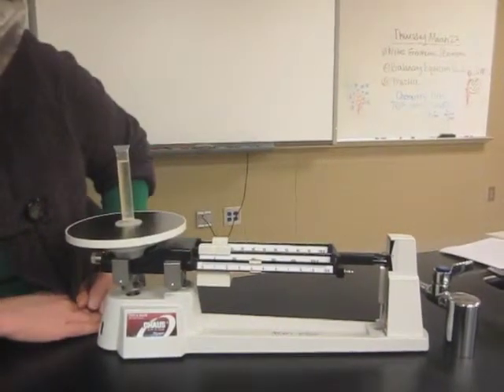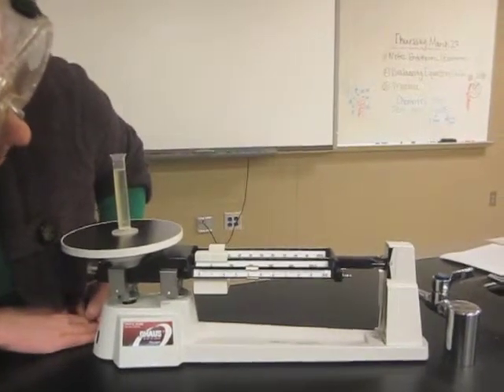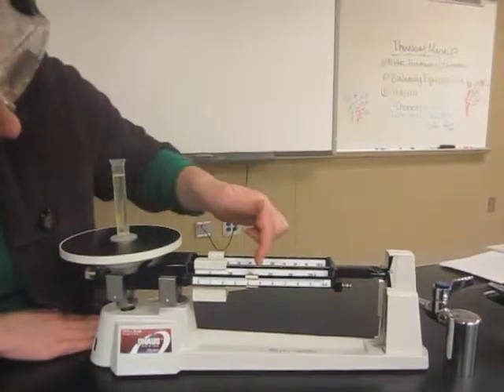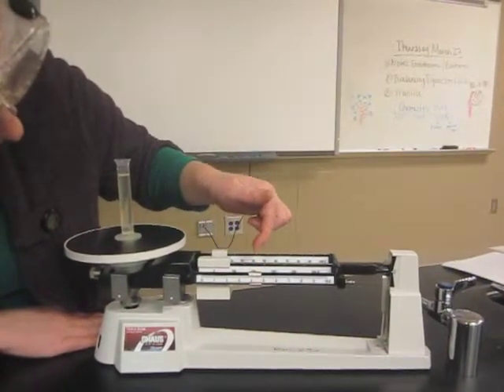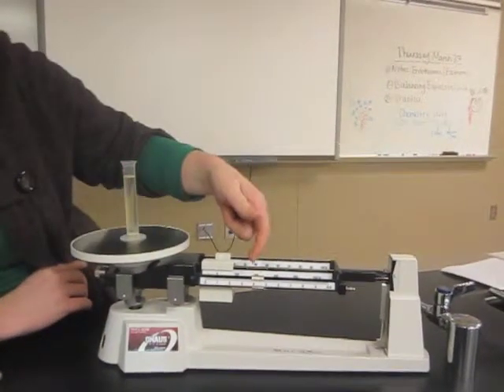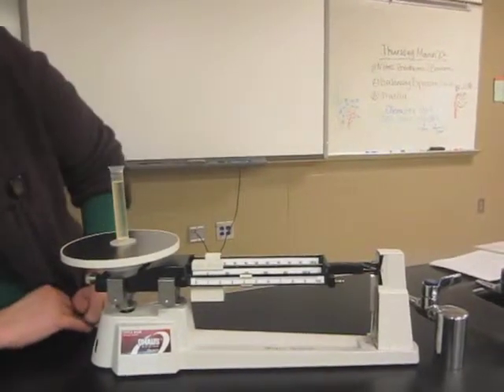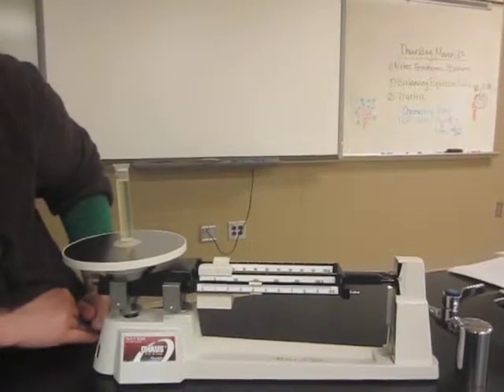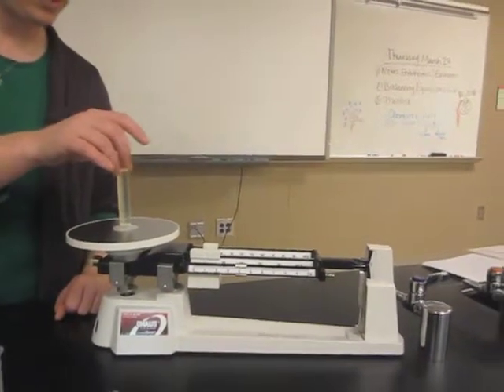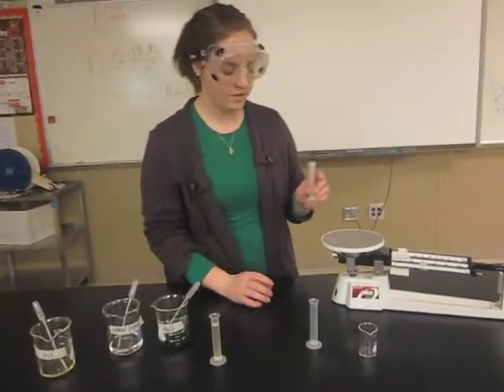The final mass of your graduated cylinder with oil is approximately 14.3 grams. You want to record your mass, then subtract your 14.3 grams from your initial mass of the empty cylinder, and record it in your chart. You want to complete the same process for the other liquids.